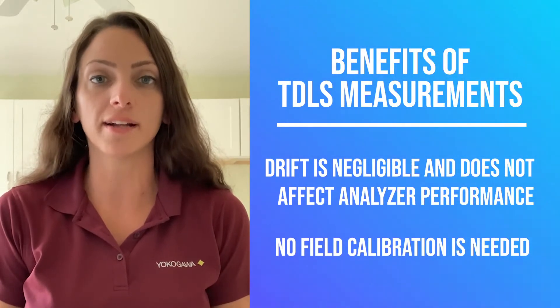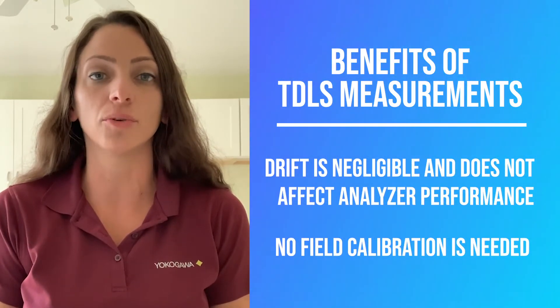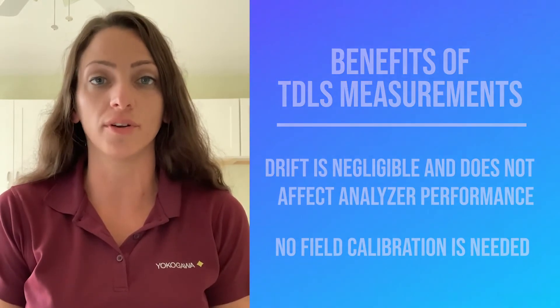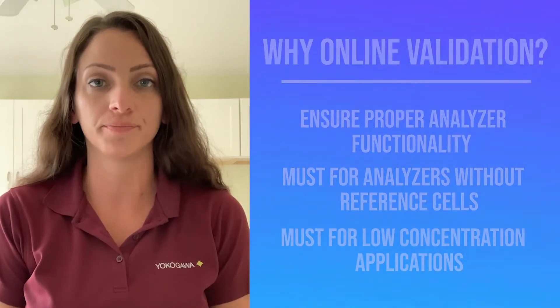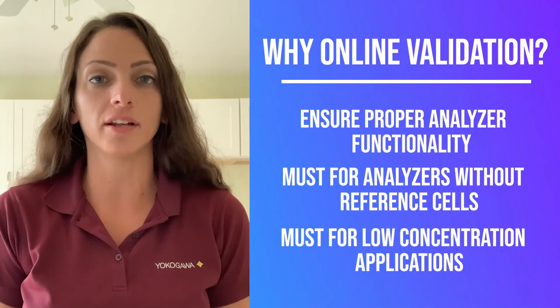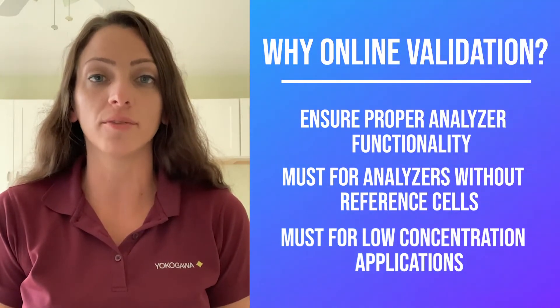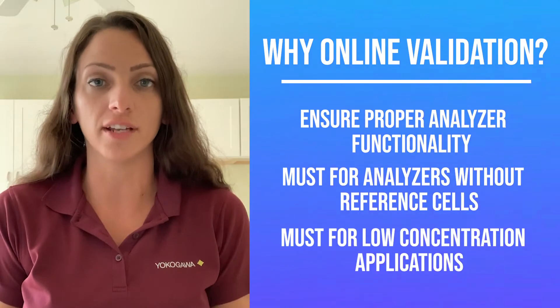If you suspect that calibration is necessary, you will need to consult with Yokogawa. To ensure proper analyzer functionality, we do recommend regular validations.